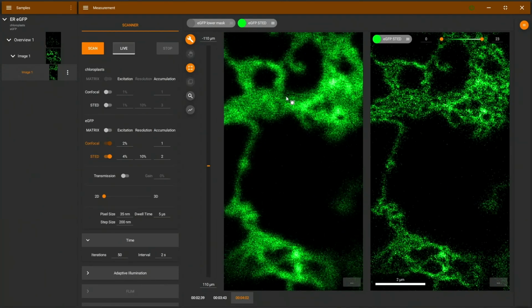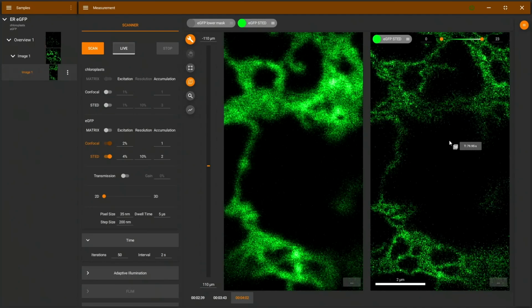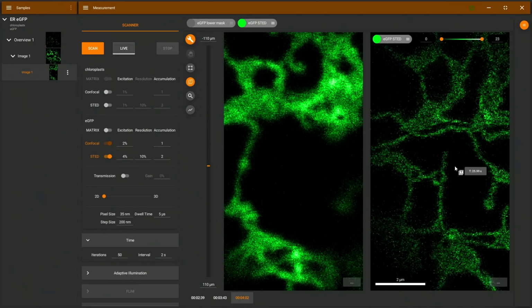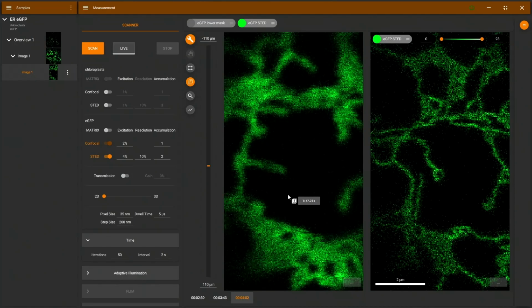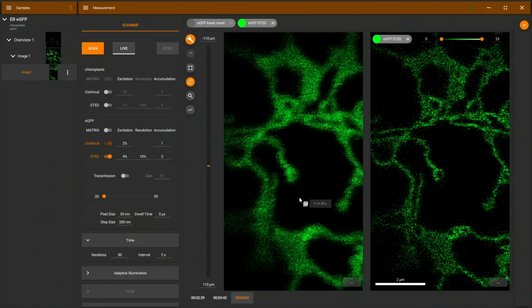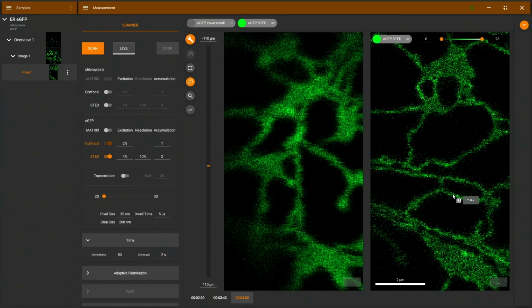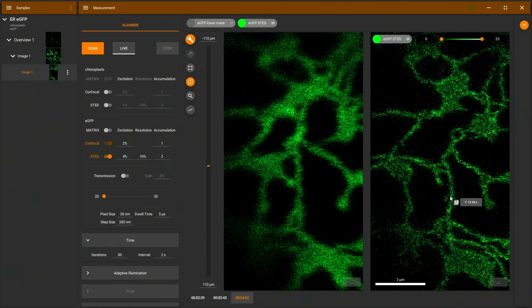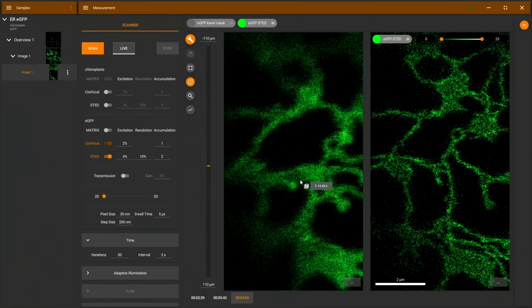Blowing this up a little bit, we look a little bit at the details here, using maybe the scrolling tool here for movies, time, and let's have a look at a nice frame. I think here we can see a nice little circle at the end of this structure. If we go into the confocal image, we can see that we cannot identify this as a hollow structure there. And I think the scan speed here is sufficient to depict these really, really highly dynamic structures as well.